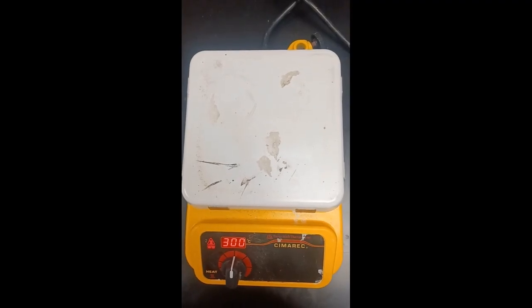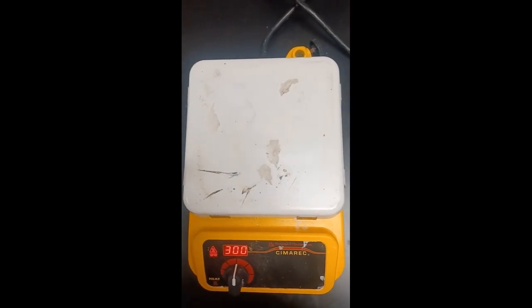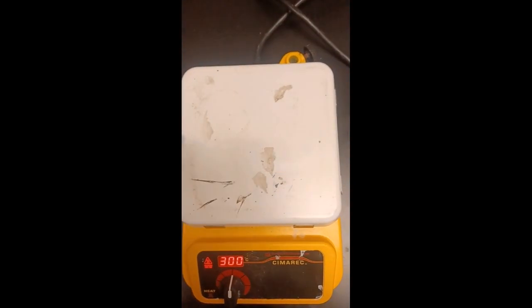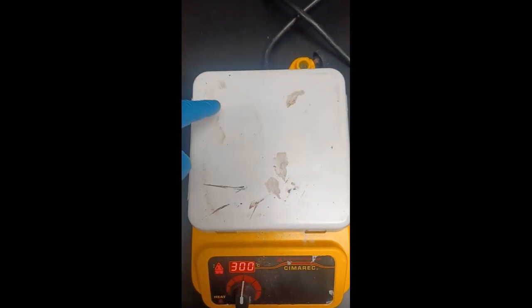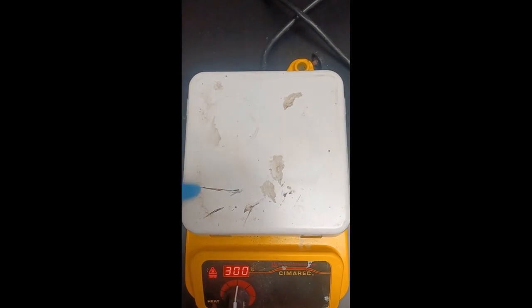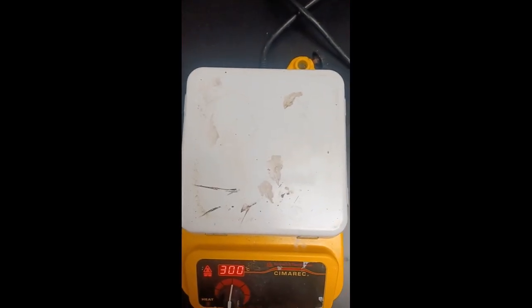Now for this next test, we're going to be melting our samples, or seeing if they melt within 1 minute. I will arrange the samples across this hot pad here, and I'll label them in the video as to what they are. From the top left corner, they will follow the same pattern, going in this order. We'll start with paraffin wax. I'm going to put these on for 1 minute, and we'll see if they melt.